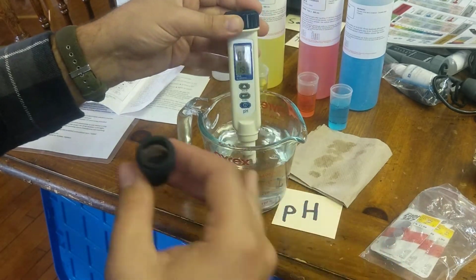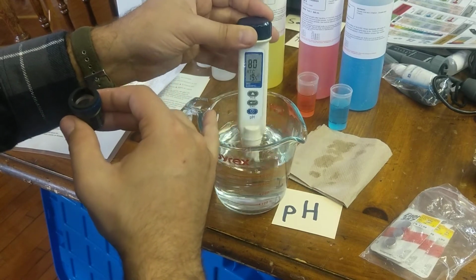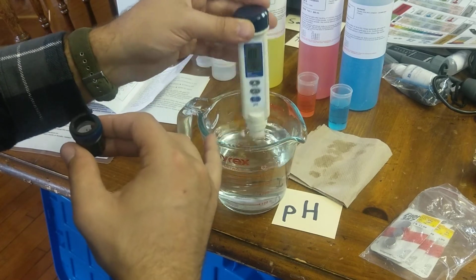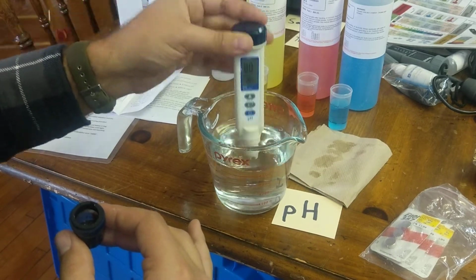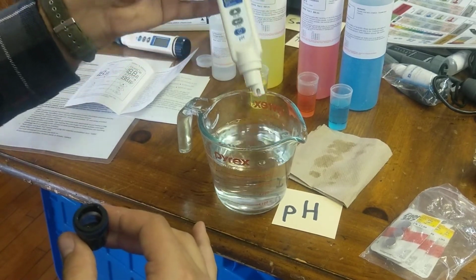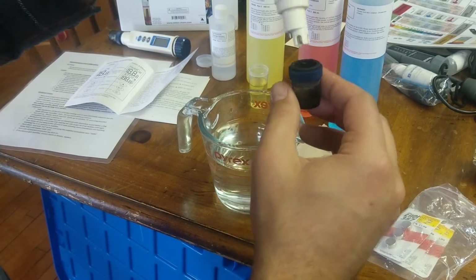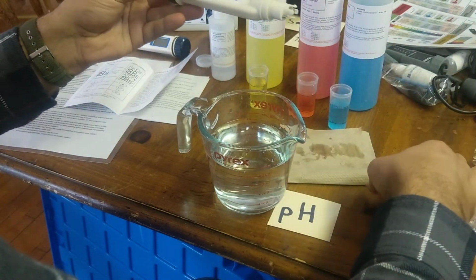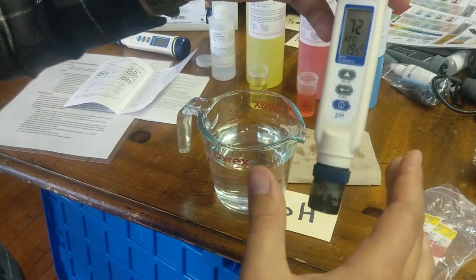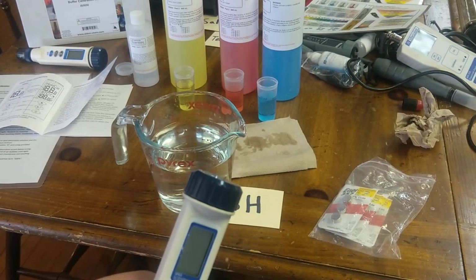So I'm just rinsing this off again. You can rinse it off in running water as well. We're almost at a pH of 7 here, which is good. That just tells me that most of the buffer has been rinsed off. There we go. Alright, yep, it's pH 7-ish. That's good. And I'm just going to wipe off the outside. There we go, not touching that bulb. Put this on in here, shut it off, and we're good. Again, long-term storage, I would take out the batteries, but otherwise, you're good to go with this.